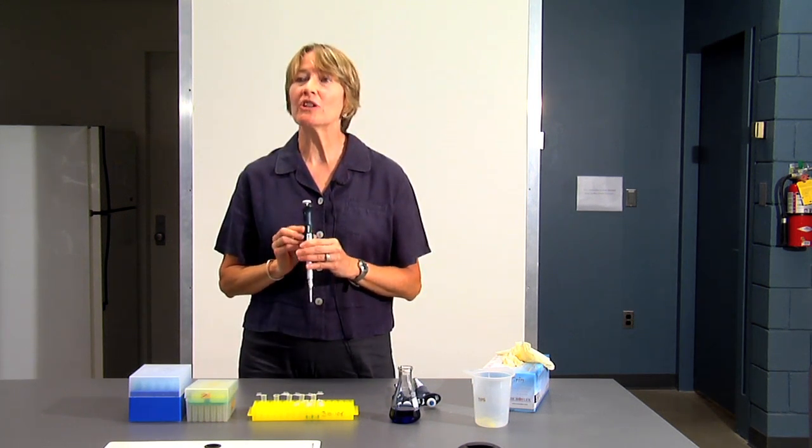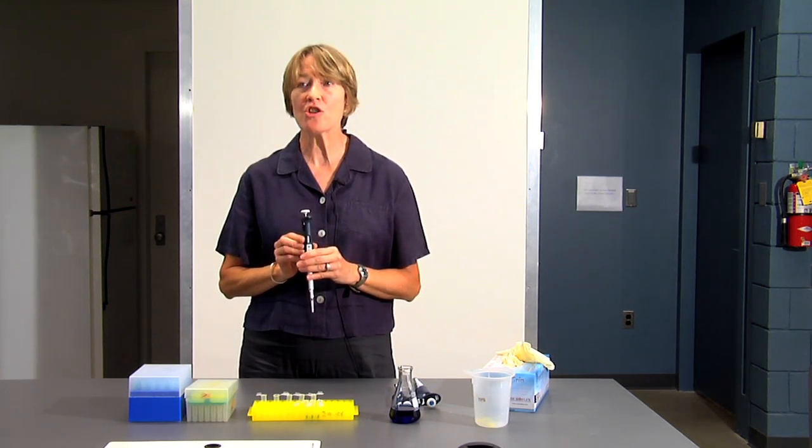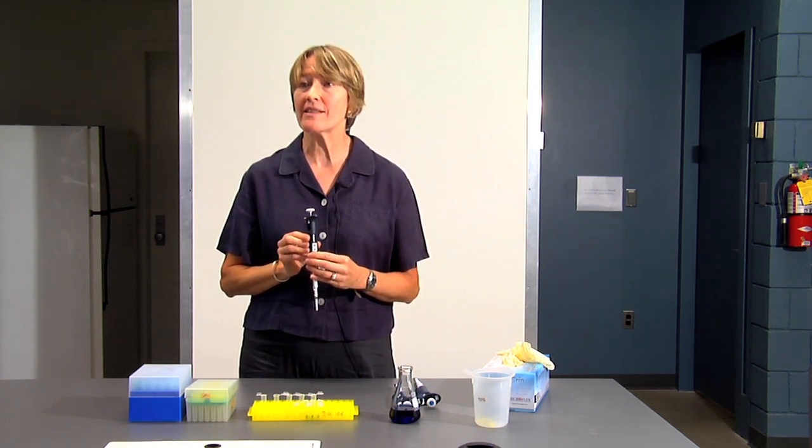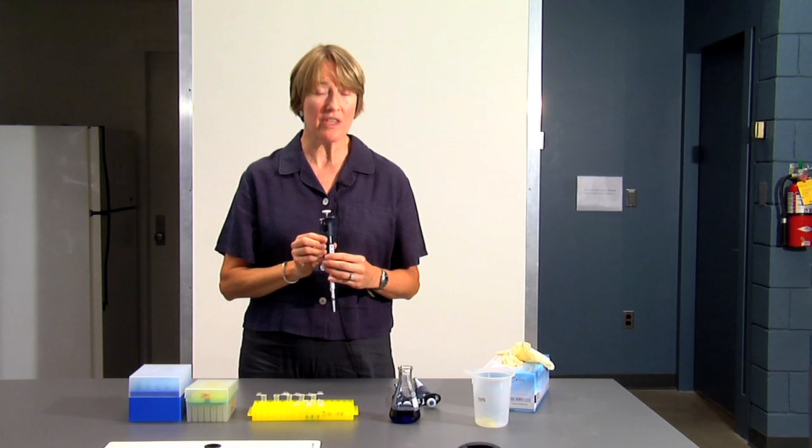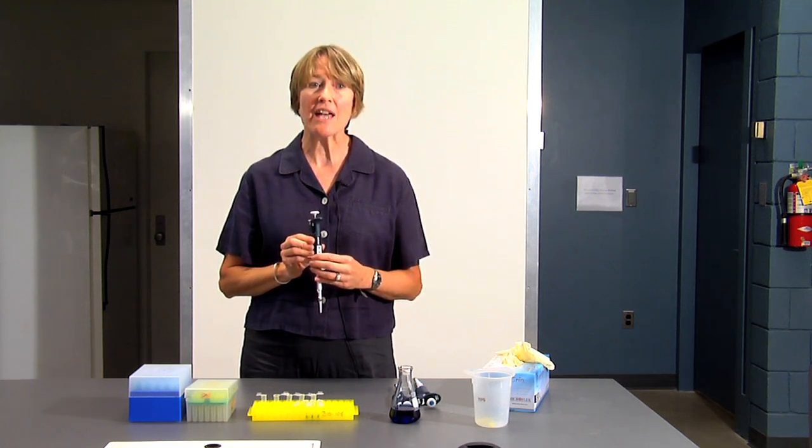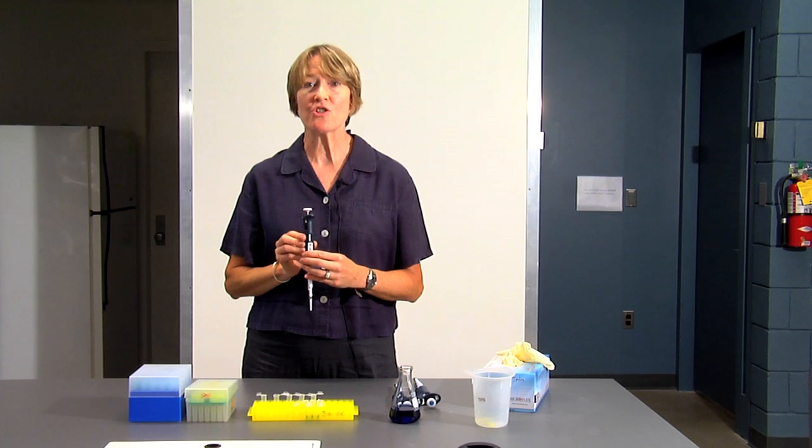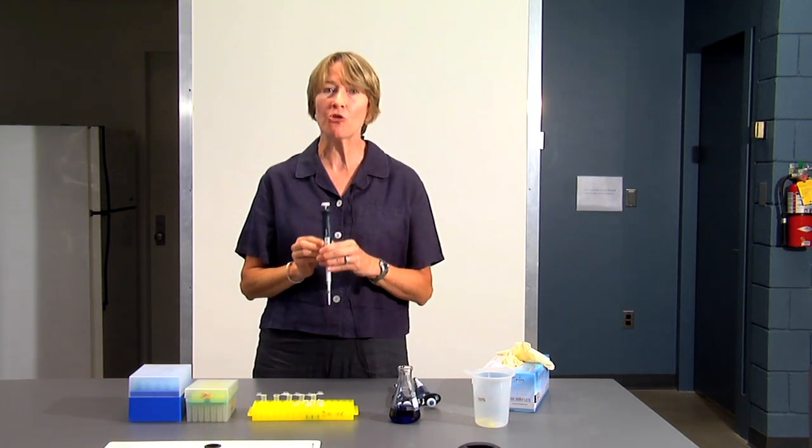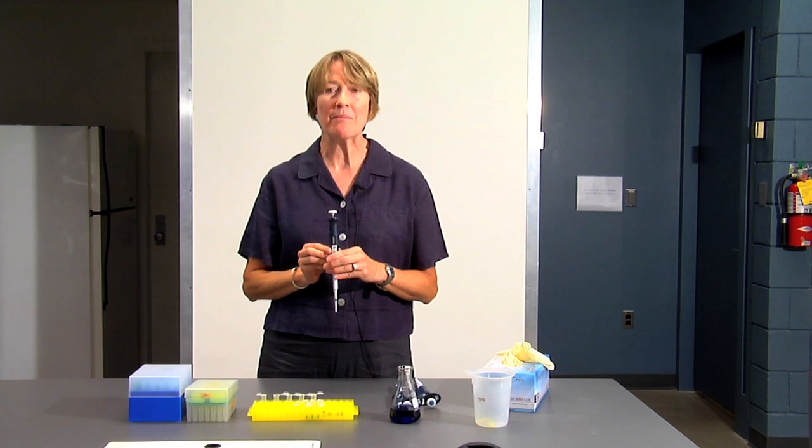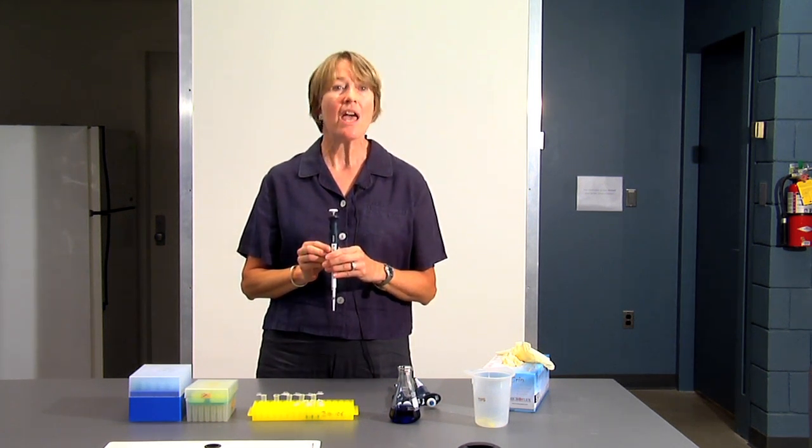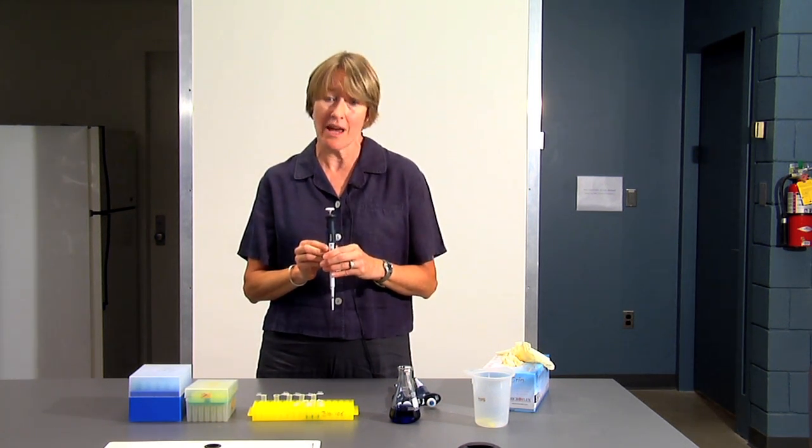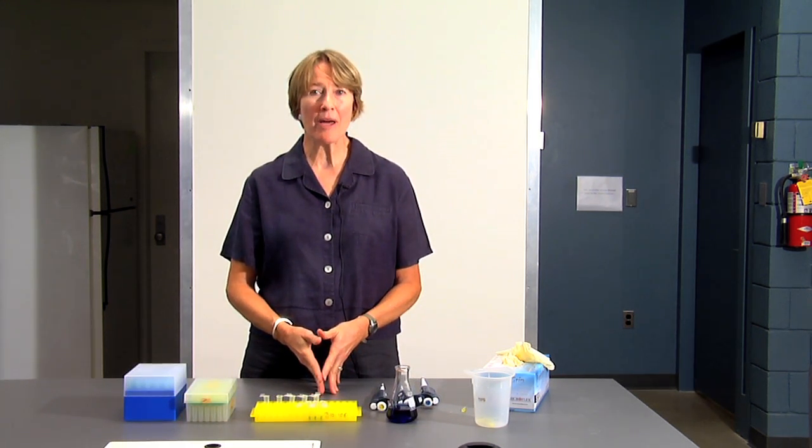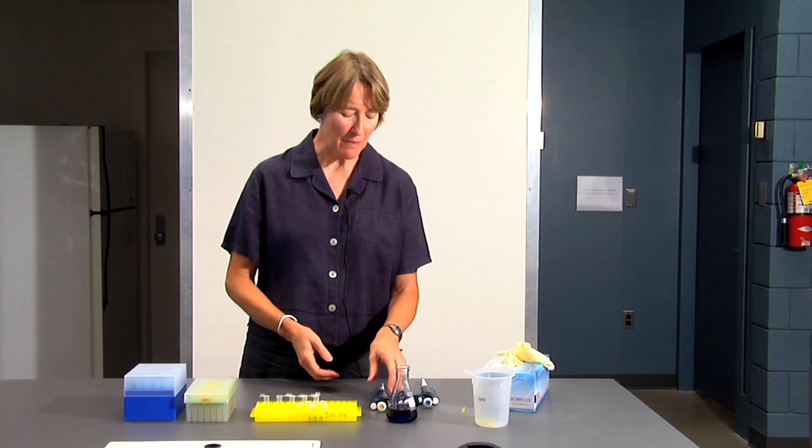Just for your information, your lab manual in the appendix also has the directions for how to set the pipettes, and it also has diagrams of each of the pipettes. So if you need that, you can look at that in lab and remind yourself how these pipettes should be set. It's very important to set the pipette correctly, or else you might be pipetting the wrong amount of liquid, and therefore your biochemical reaction is not going to work very well. Now I'm going to show you how to actually use the pipettes to measure a specified volume.